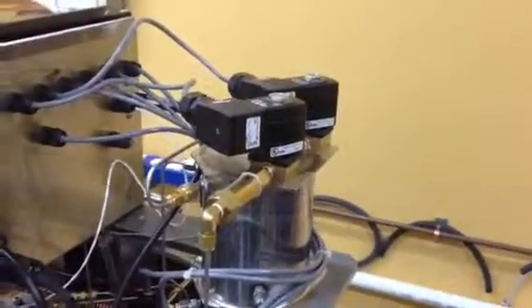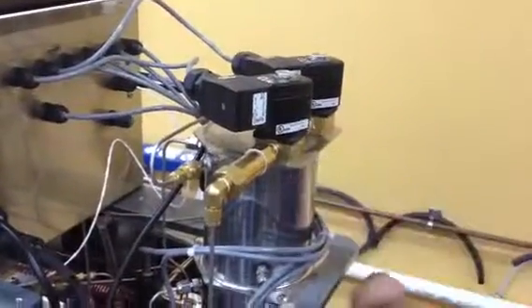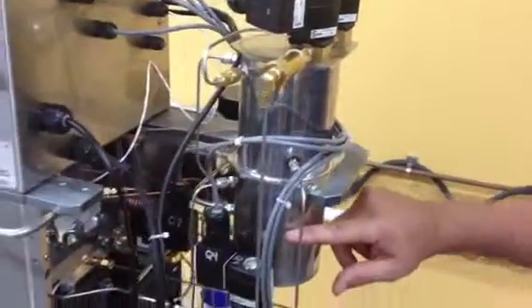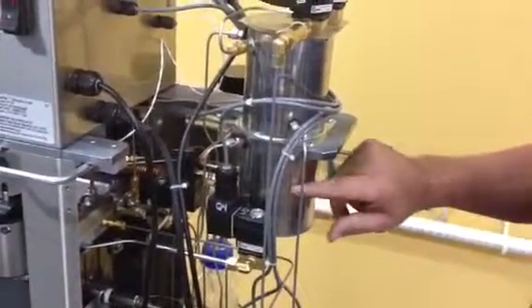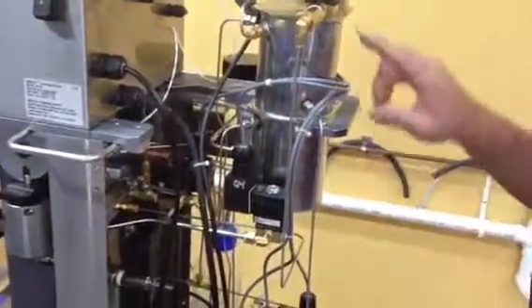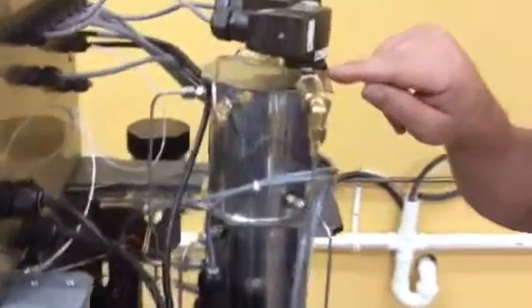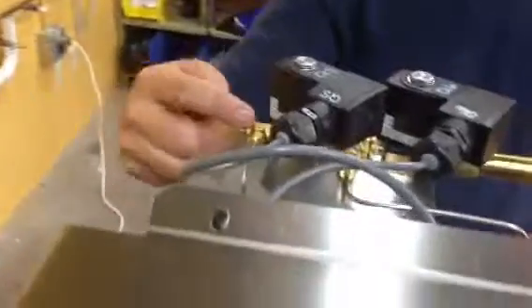A couple more places on the back. We have our Q6 valve. This valve here is for the drain. At the end of the run, all your solvent comes through this valve and into your condenser and back into your reservoir. This is the reservoir that holds your ether in between runs. This is directly hooked up to the sight tube up front that you're telling me it comes out low on. So you want to check these fittings. Anything to go into this side of the Q6. On the opposite side is Q5. You want to check the fittings on that side also.